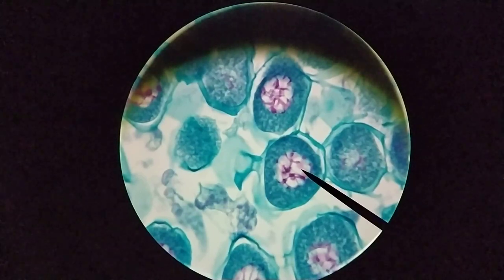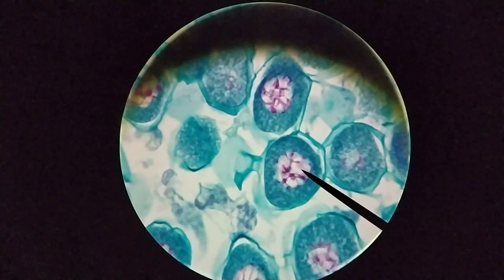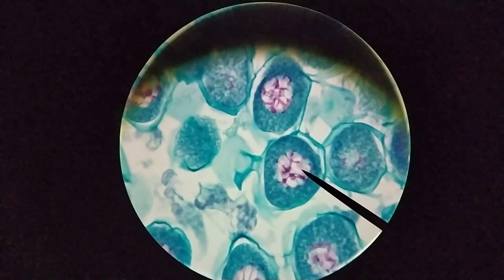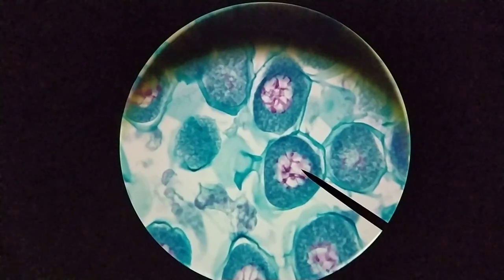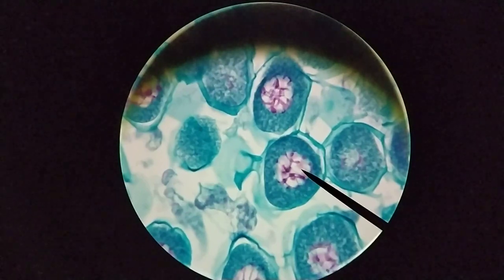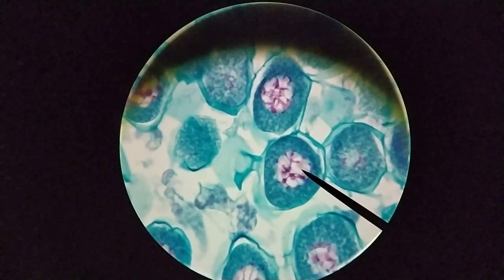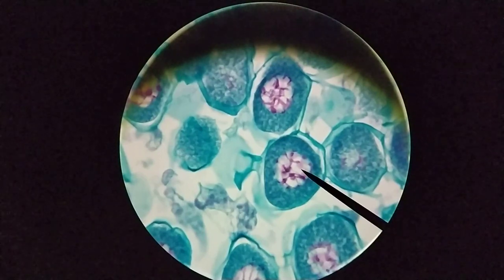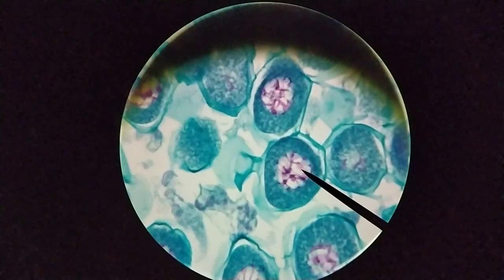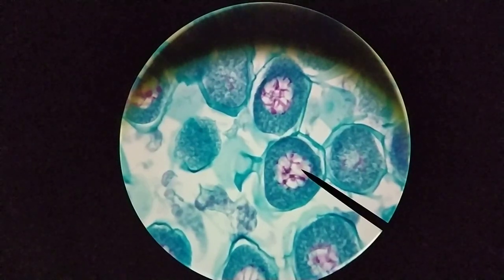The chromosomes are almost fully condensed at this point. Prophase and any of these stages really is a continuum. They would have started with just a granular appearance to the nucleus, and then over time the chromatin condenses and you start to see thin strands — basically the condensing chromosomes — while the nucleus still looks quite full. Then over time we get to a point like this where you see less material inside the nucleus because it's getting more and more condensed, and the thickness of the chromosomes increases. That's what you're seeing in this case.